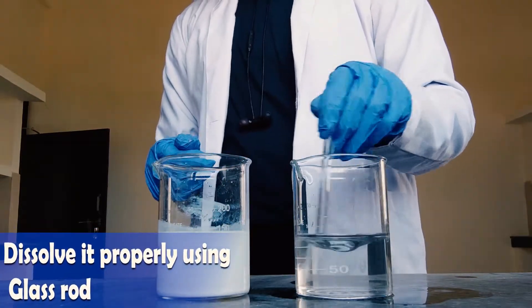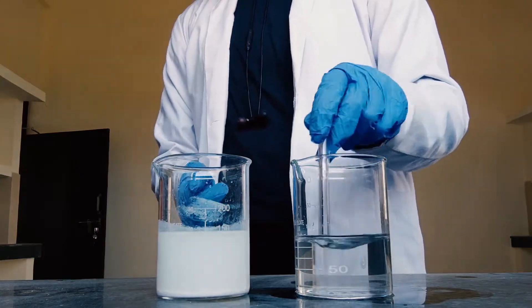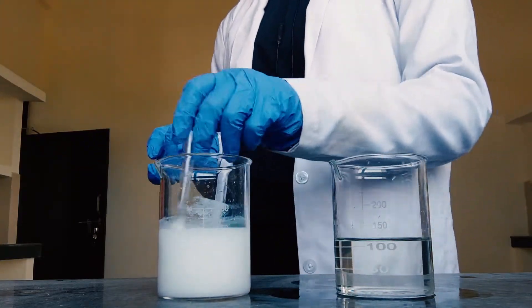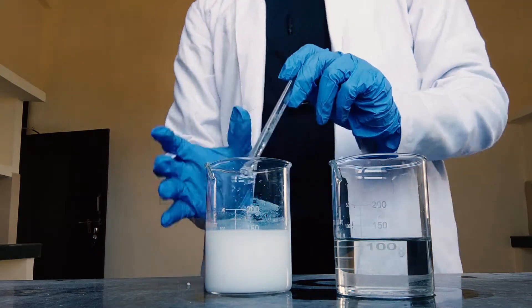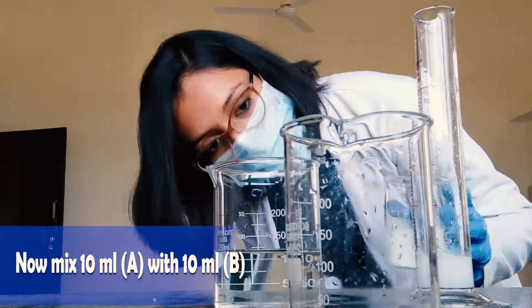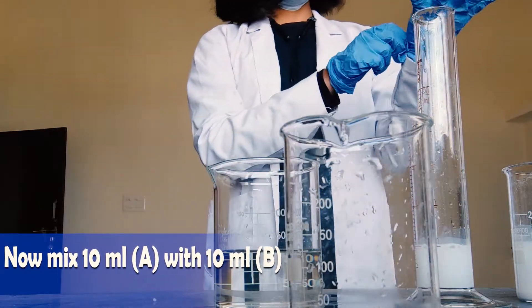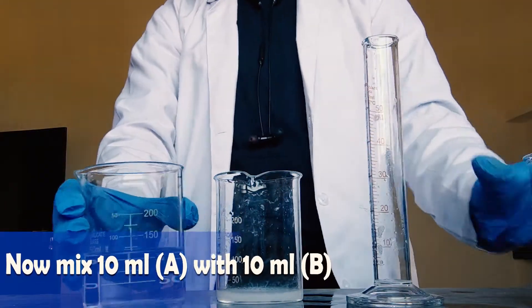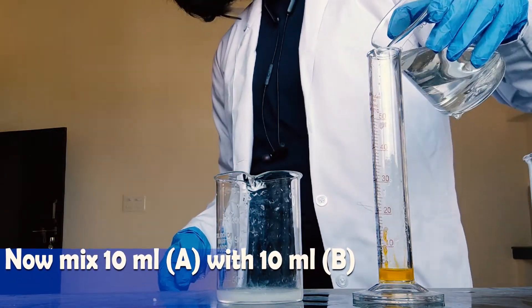Now we have solution A and solution B ready. Now comes the very important part — you have to mix 10 ml of solution A with 10 ml of solution B. With the help of a measuring cylinder, first measure 10 ml of solution A and take it in a beaker, then measure 10 ml of solution B and mix both solutions together.